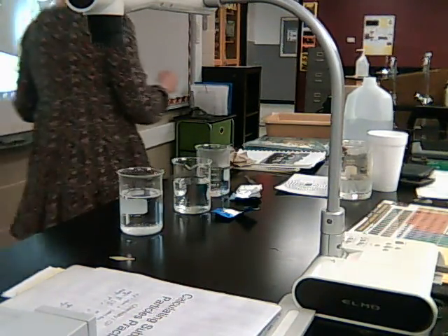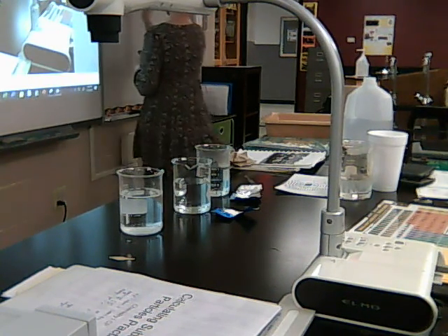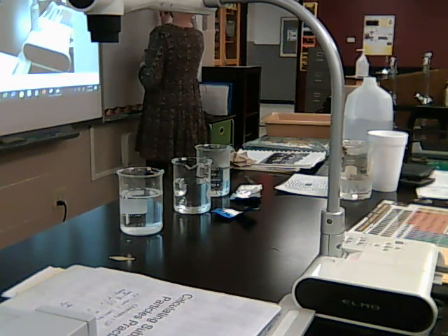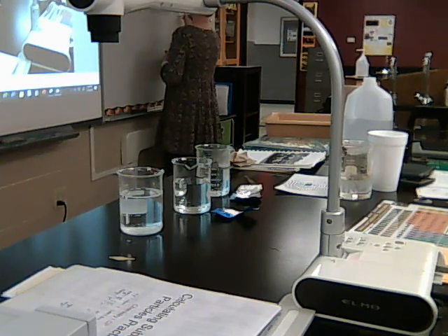So I might write that on the board, and you guys can type it somewhere if you need to. So 144 seconds was a whole tablet. And remember, that was our cold water.